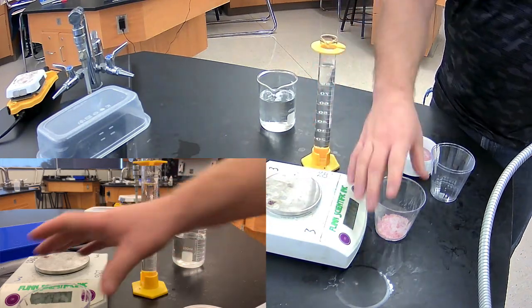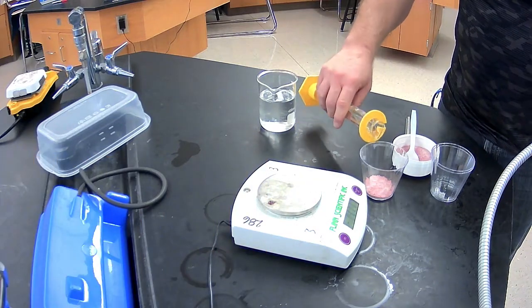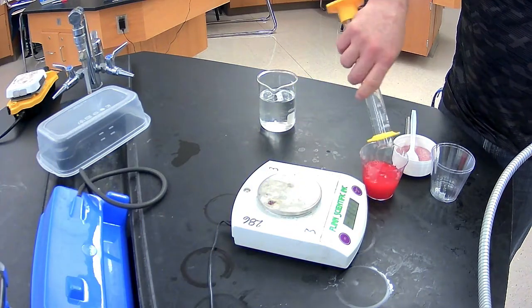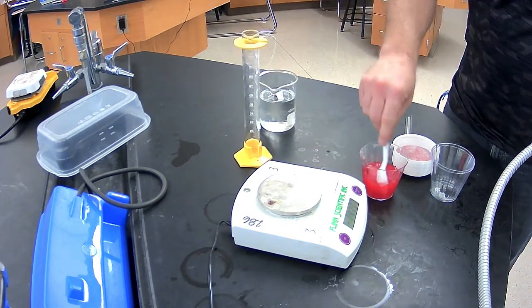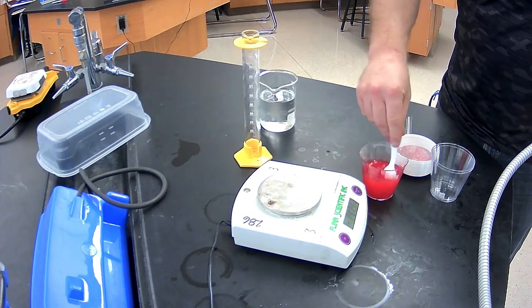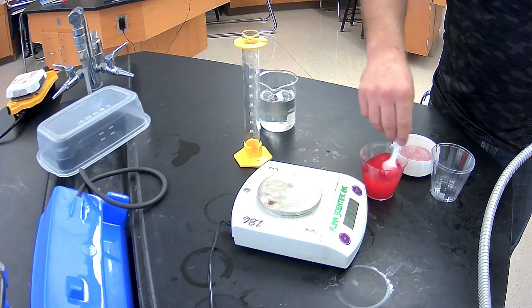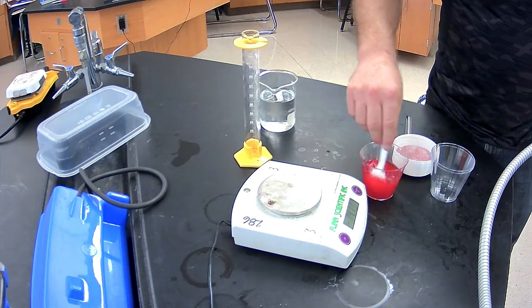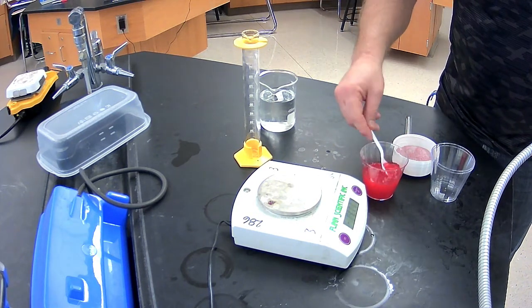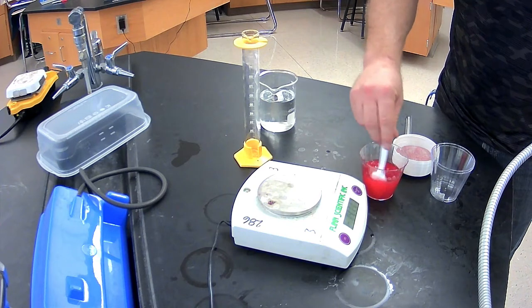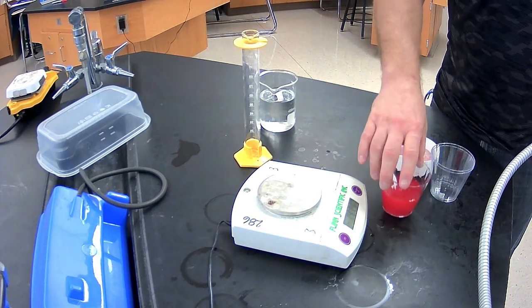So now I have my solute right here, proper mass of that. I have my solvent. Put the two together and we will make our solution. Now, this is our stock solution. And we probably want to keep track of that stock solution in terms of what this is. Make sure we dissolve all the particles. And we now have our first solution created.